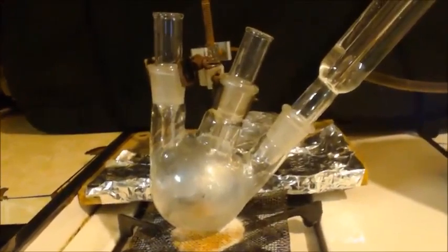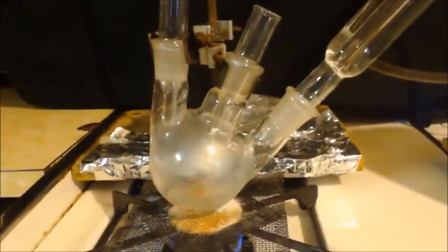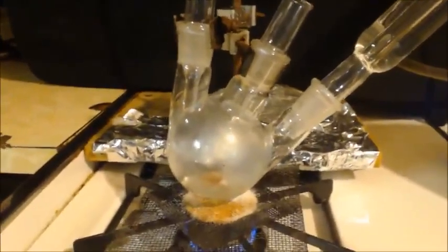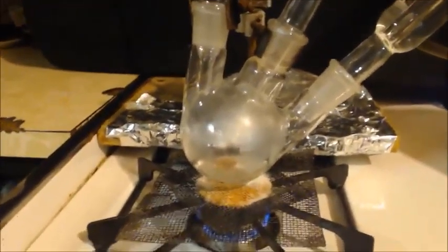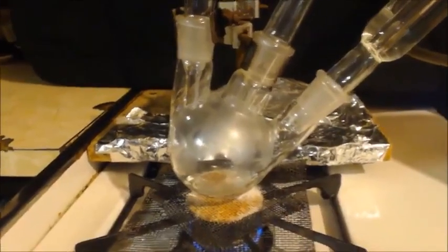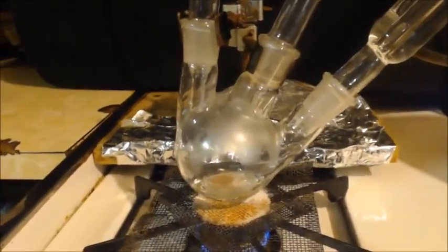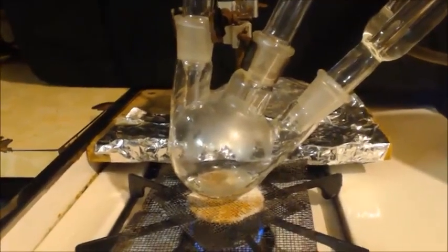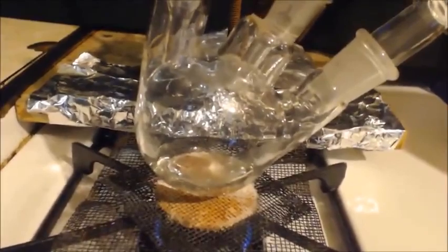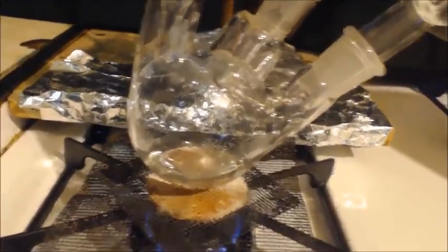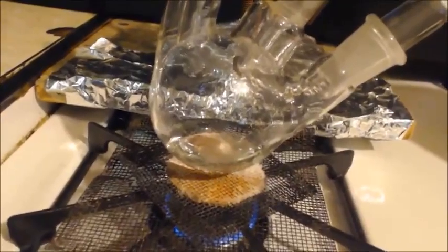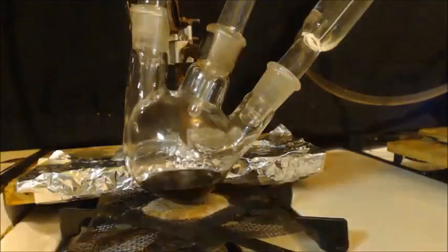145, 140, 149, somewhere in between there, you're producing ether, or you're producing an SN2 between the two alcohols, which is the same alcohol. If this was ethanol, you'd make diethyl ether. But my whole point is, I don't want to do that. I want the E2 elimination or the E1 elimination, because it's a secondary carbon. So eliminations take a lot of energy, so I want to get this up to 170. Around 150 it starts making it, but you don't want it to go too slow. So I got to get it all the way up to 170°C. Let me get it close, and I'll get another clip in.